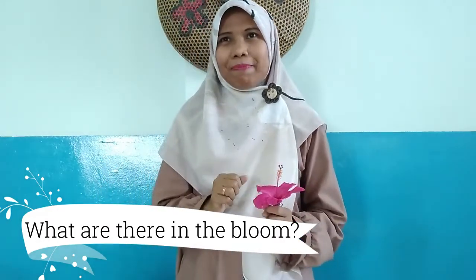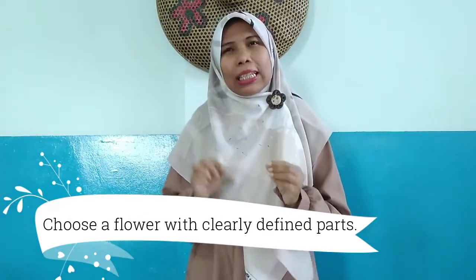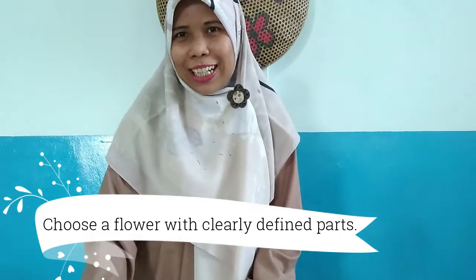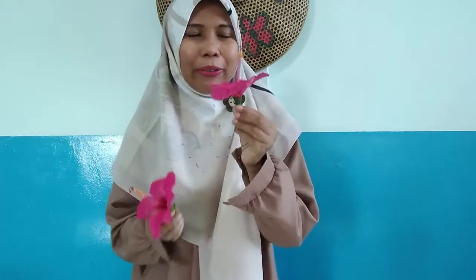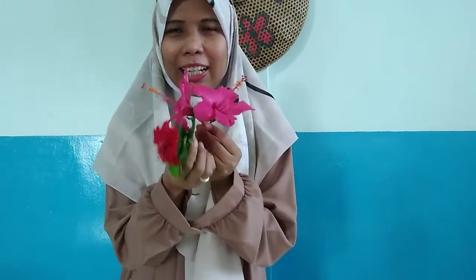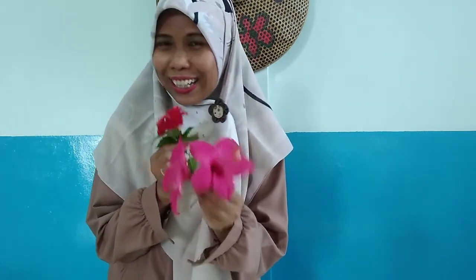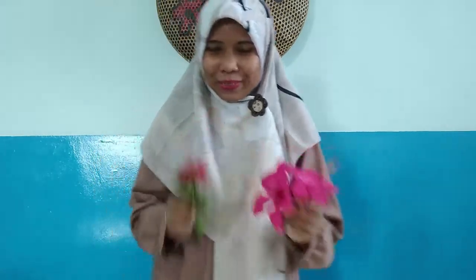The first step of a flower dissection is you have to go out and find a blossom to cut up. You can ask it from your neighbor's yard. Either way, make sure that you choose a flower with clearly defined parts. Today, teacher Ellie already cut out a hibiscus flower like this one. Yeah, teacher Ellie took it from teacher Ellie's neighbor's yard. Okay, are you ready? Let's continue.